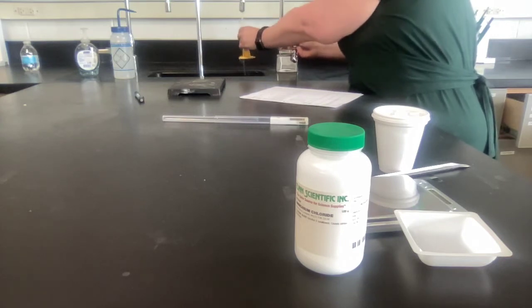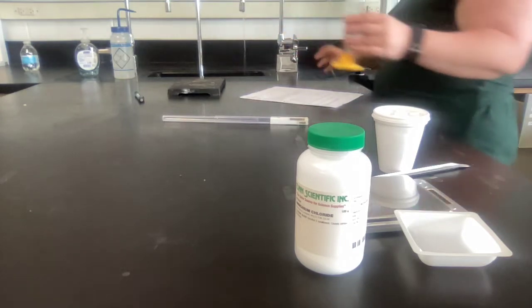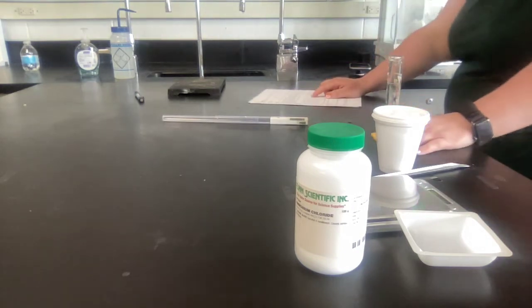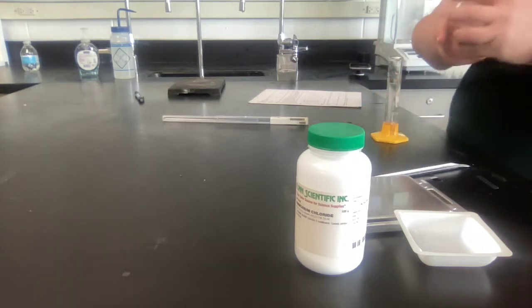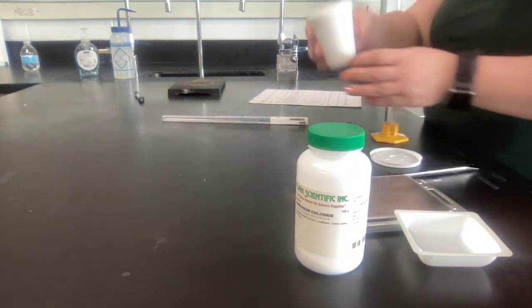It doesn't need to be distilled. Write down the exact volume of the water. So if you got 26.5, go ahead and write that exact volume in your data table on your paper. You're then going to pour the water into your Styrofoam cup.